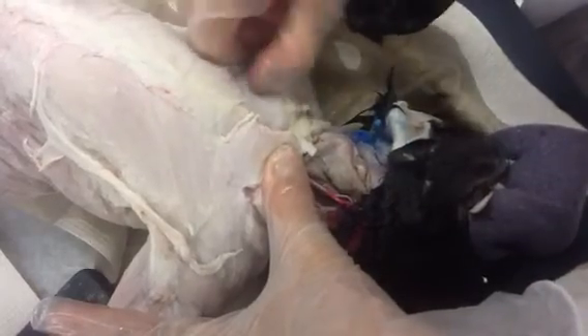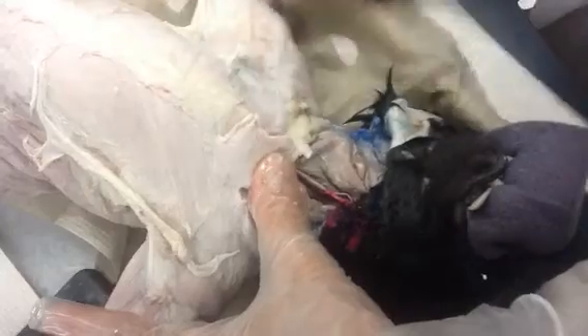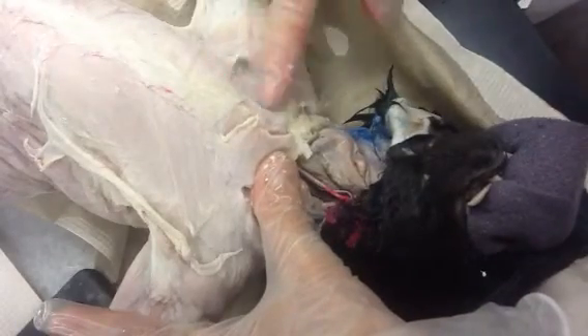I'm going to let you guys look and see if you can find a couple of those other chest muscles in here. This one got cut a little bit, so compare to this side over here. See if you can tease away some of this white stuff and see the muscle fibers right in here.